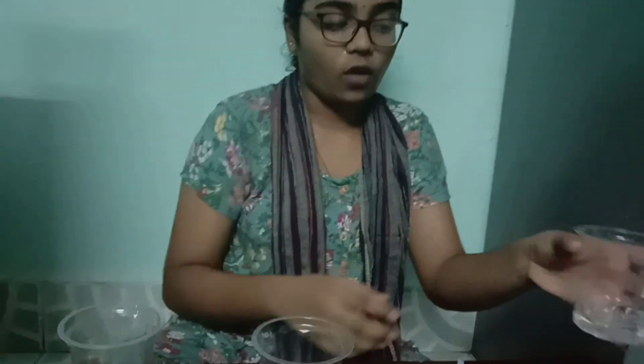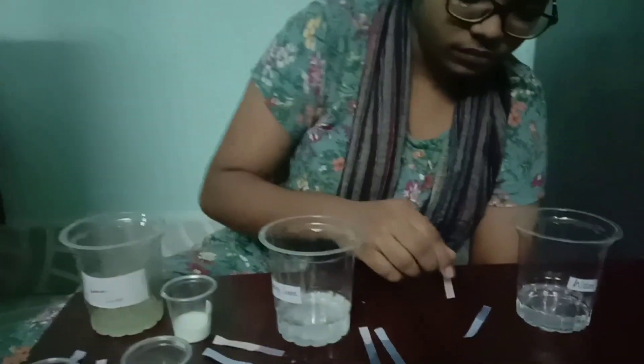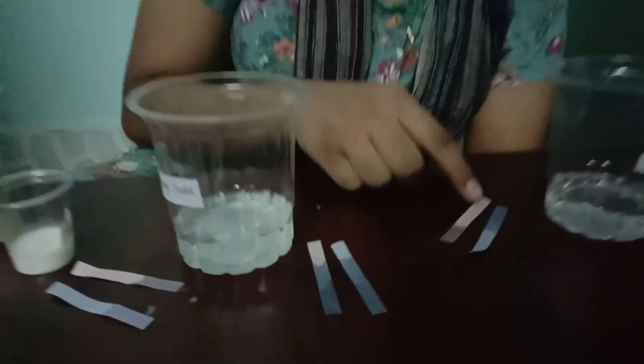Now I am taking some water. First I am dipping blue litmus paper. See, there is no change. Now I am taking red litmus paper and dipping it in. Now also there is no change. So it is neutral in nature — it is not turning from blue to red or red to blue in litmus paper.